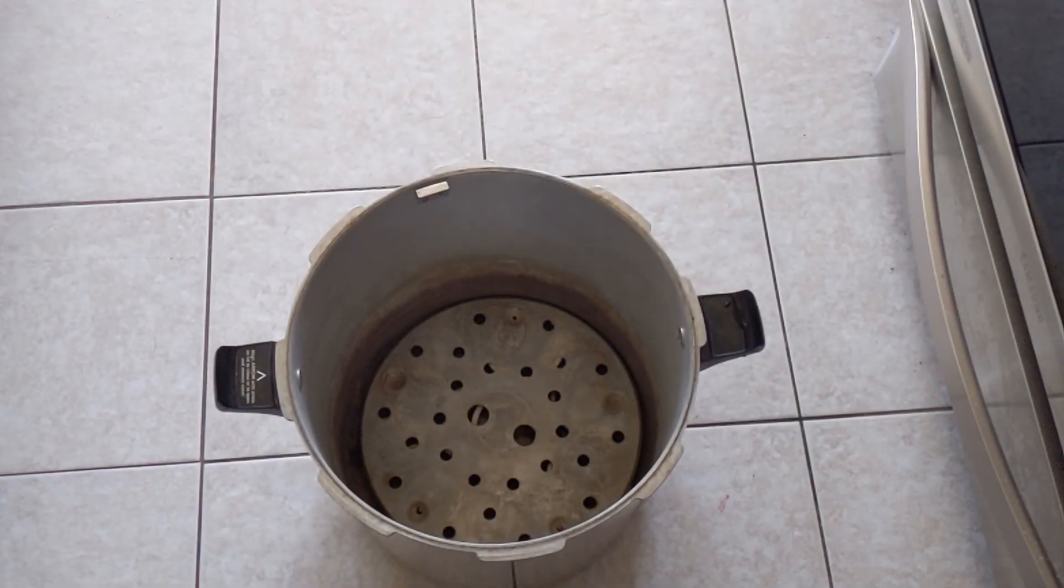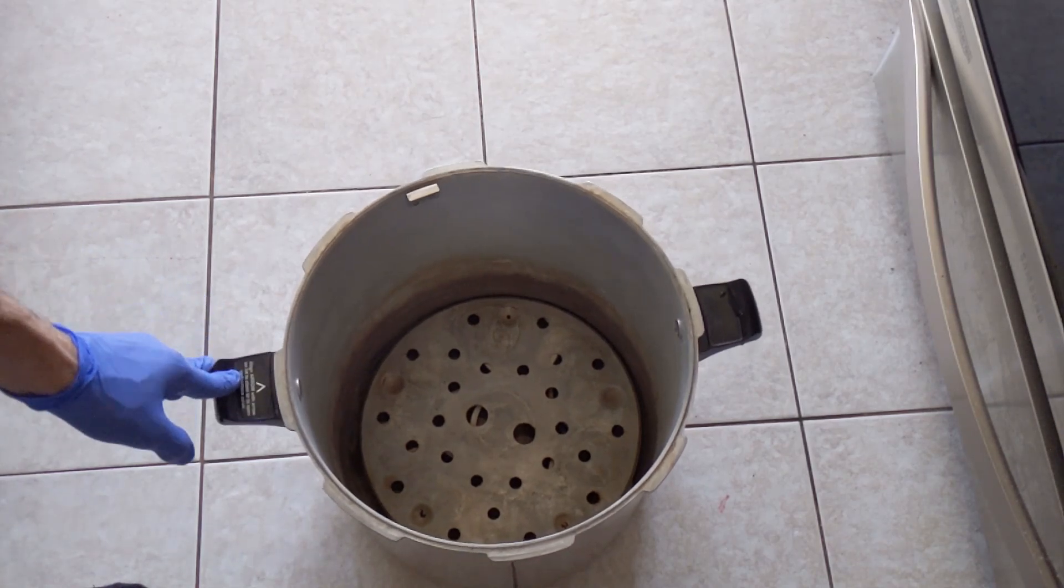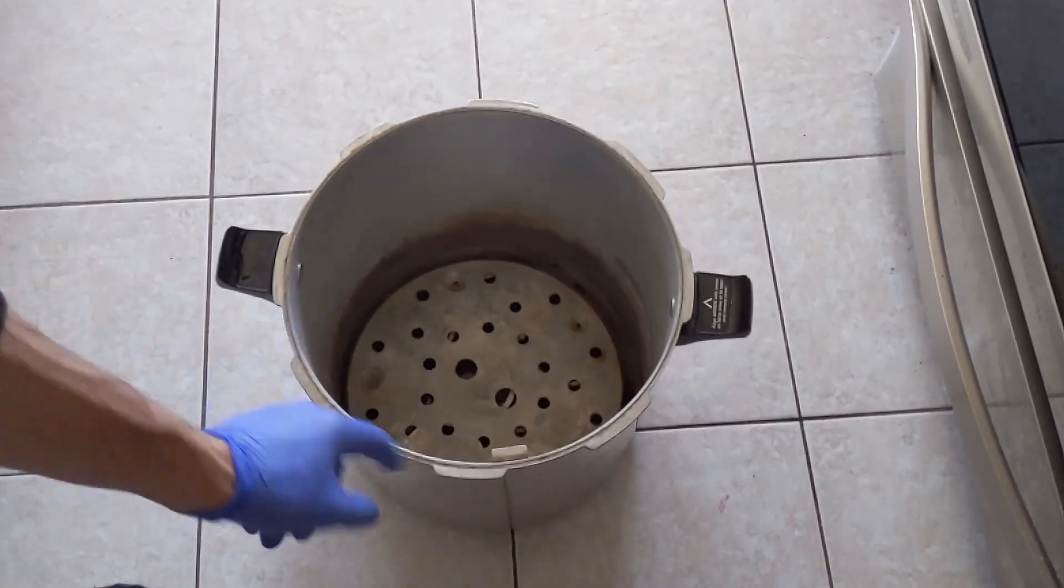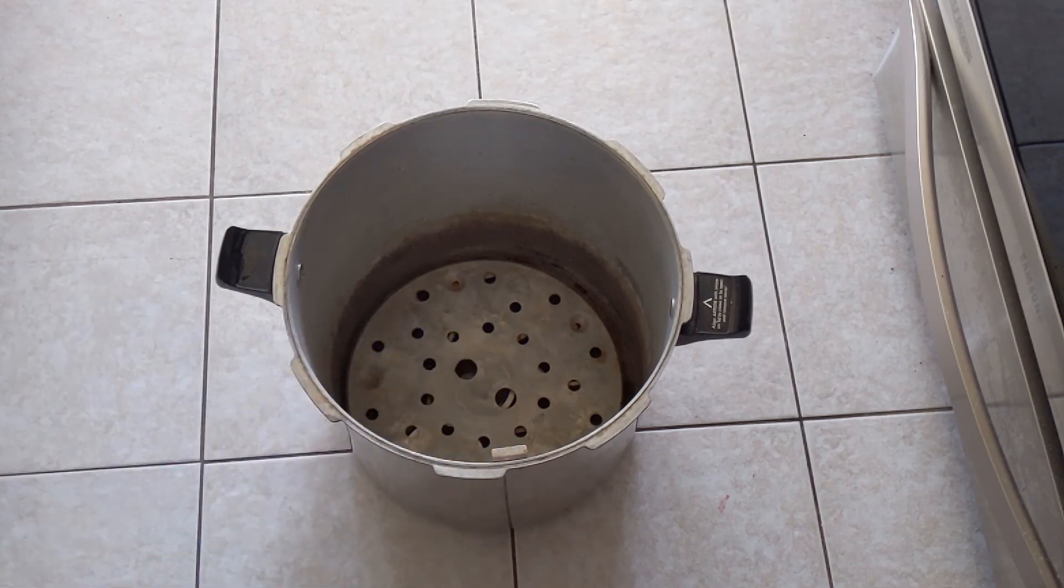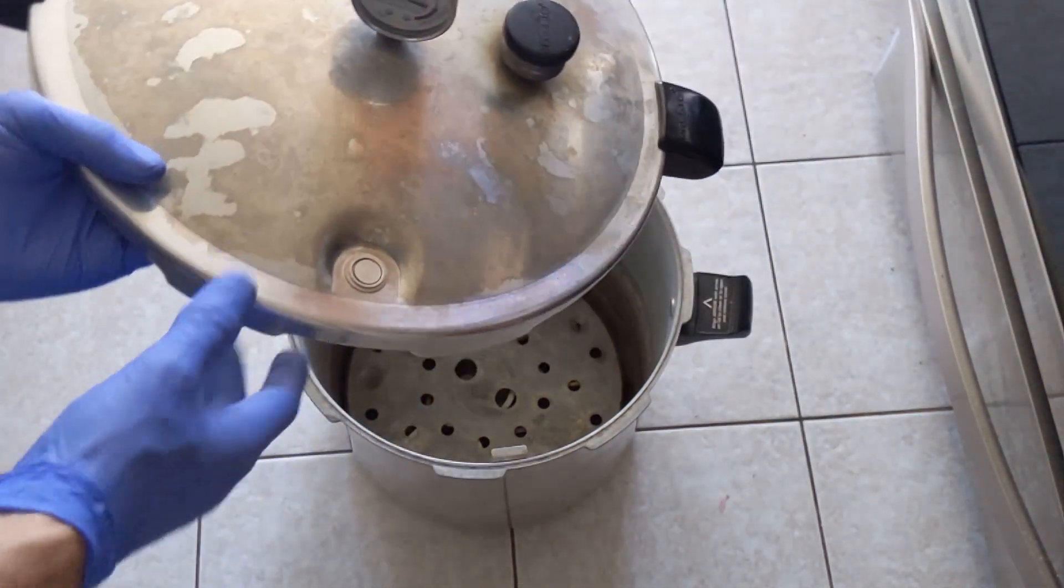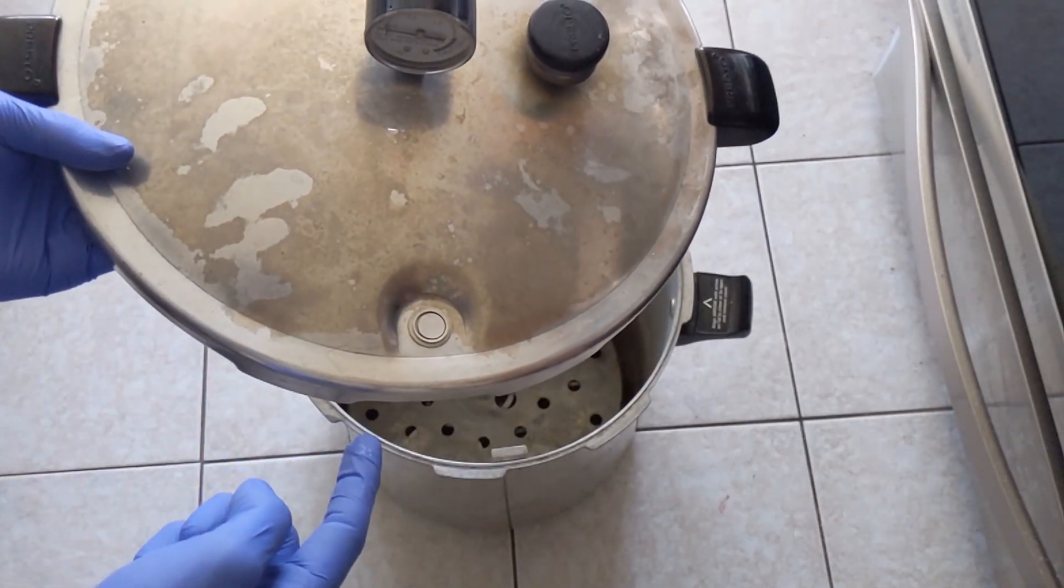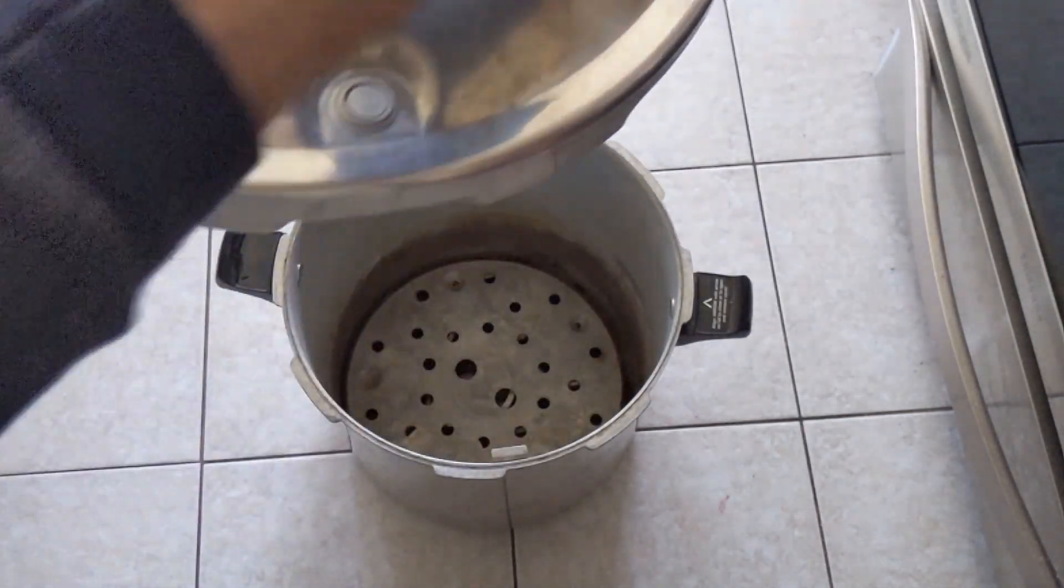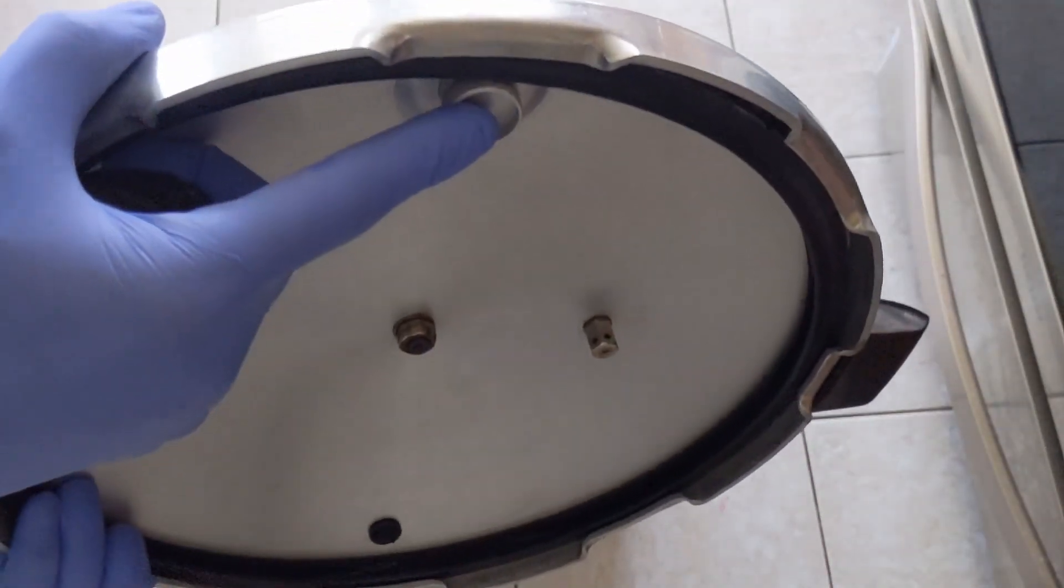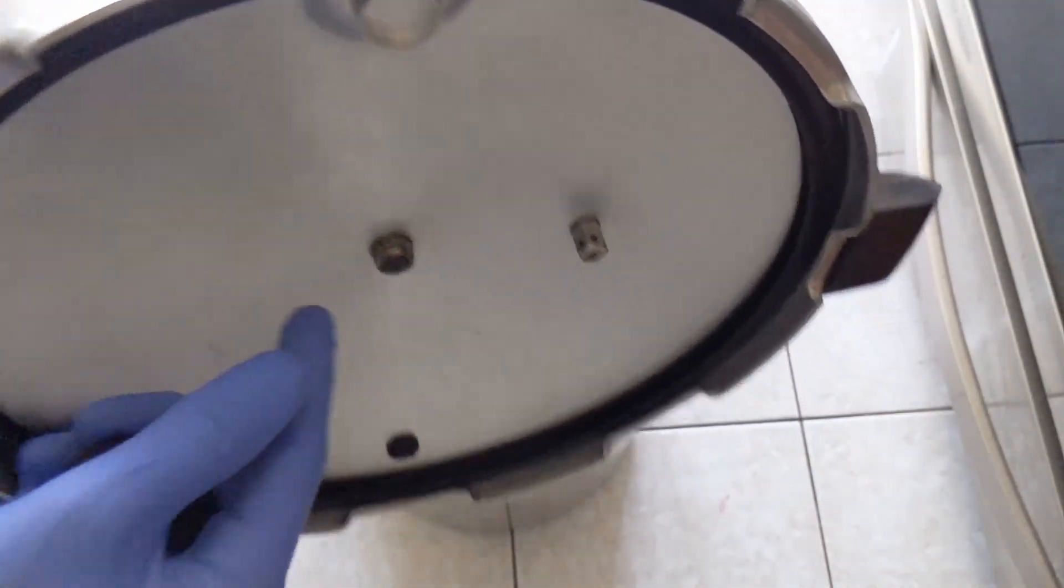Alright, here's a shot on my floor. Just kidding. I'm going to show you how I actually load the bags in the pressure cooker. This little thing right here is where the lid is going to be, the access point right here, that's where it latches. So I want to make sure my bags are not interfering with the bottom of this or any of these. That's why there's a plate on there.